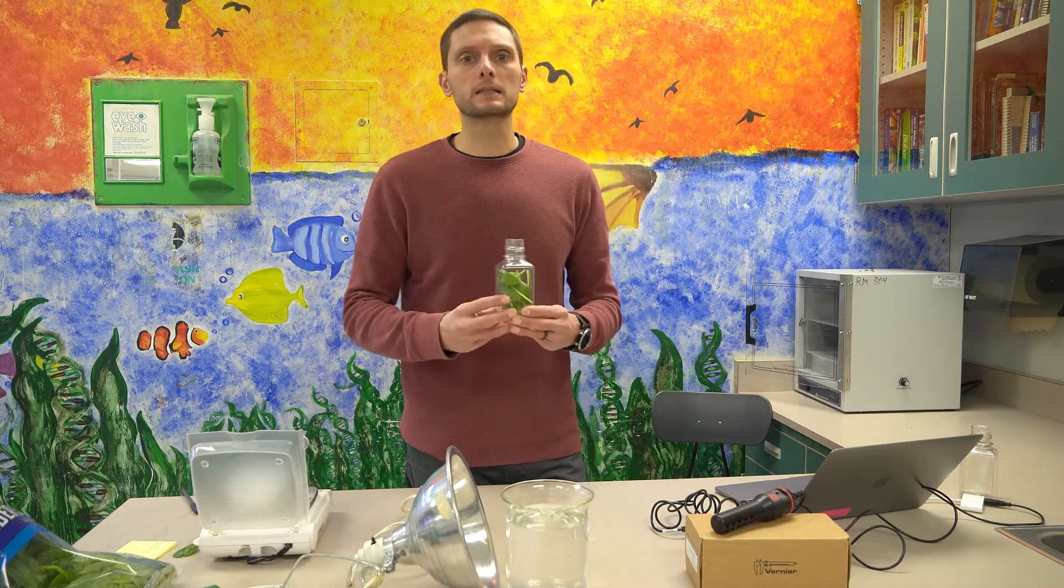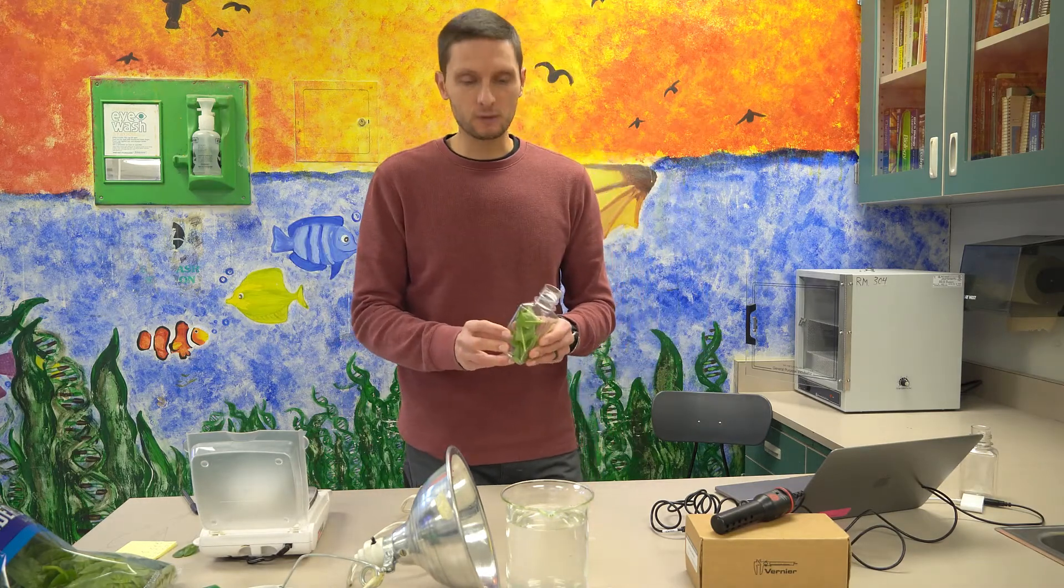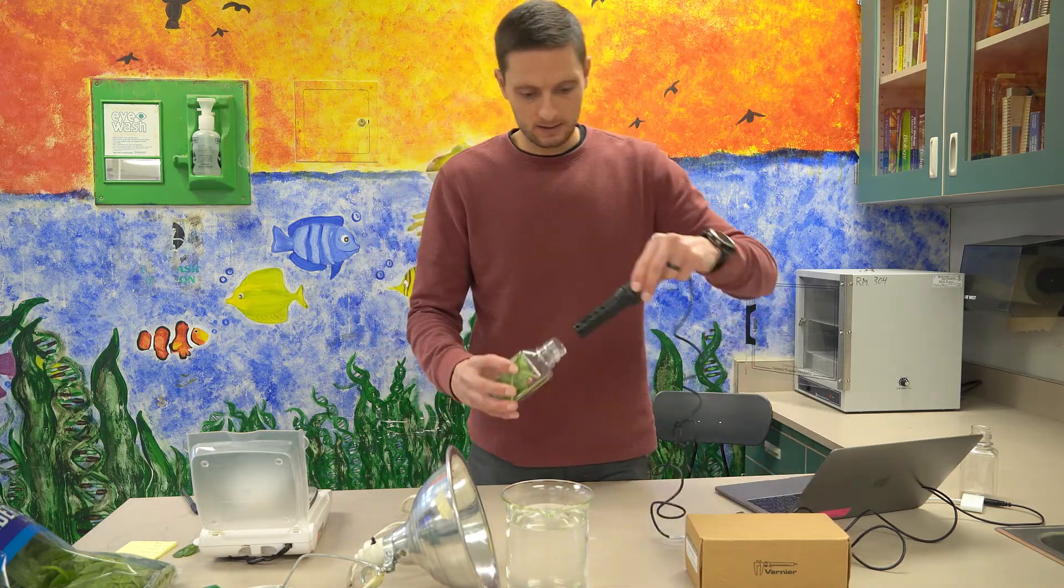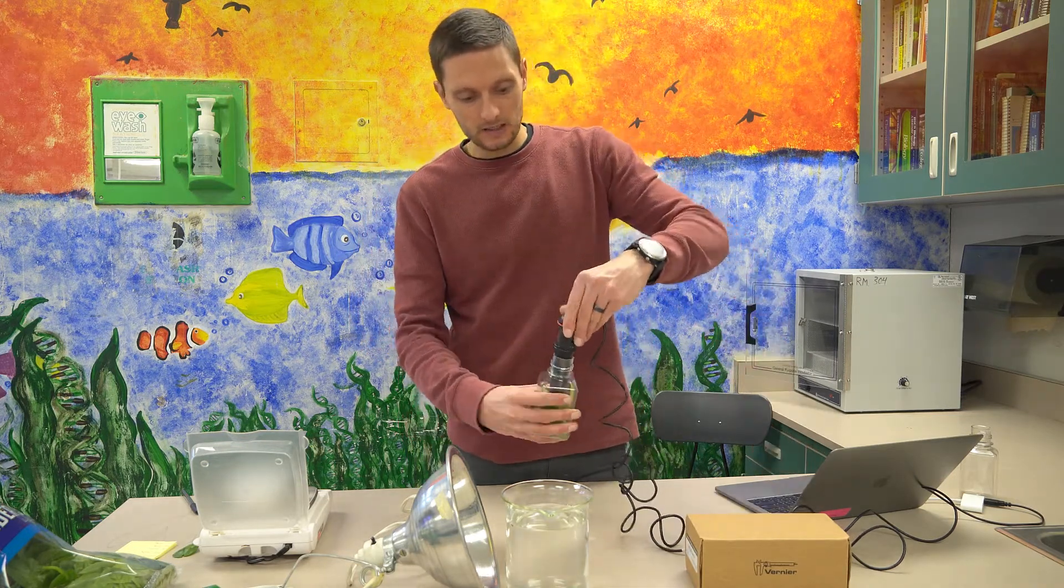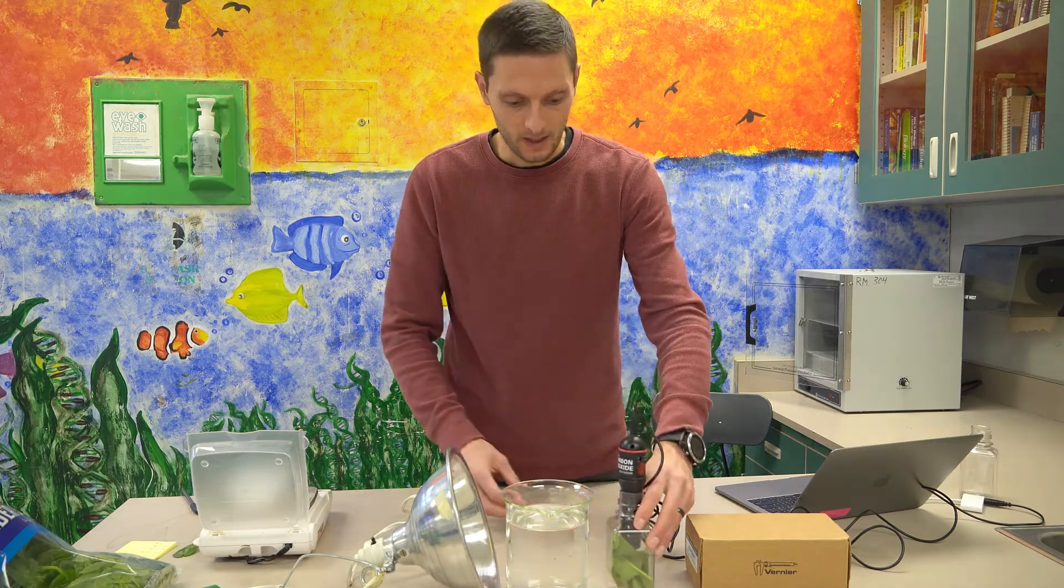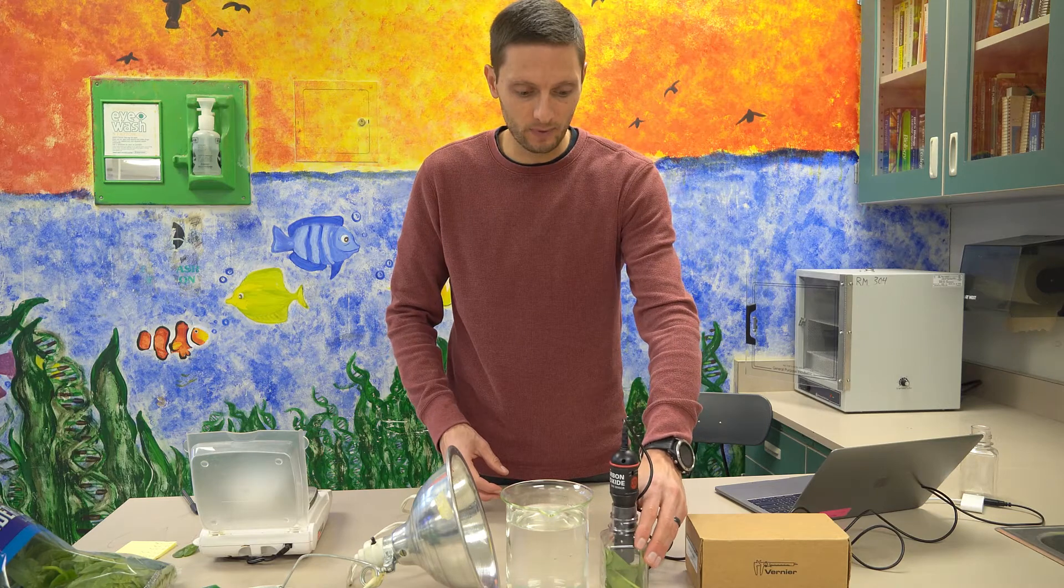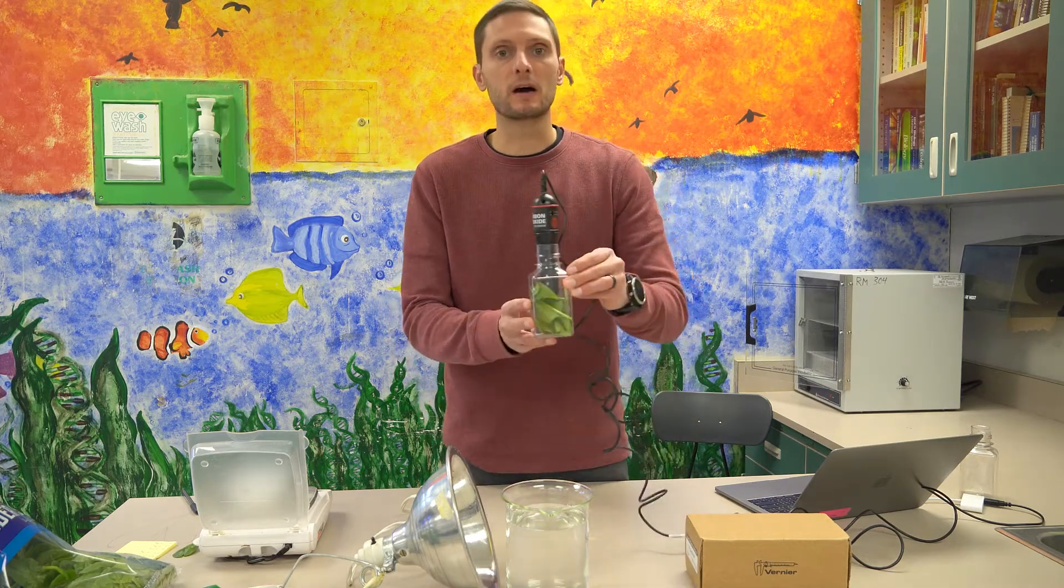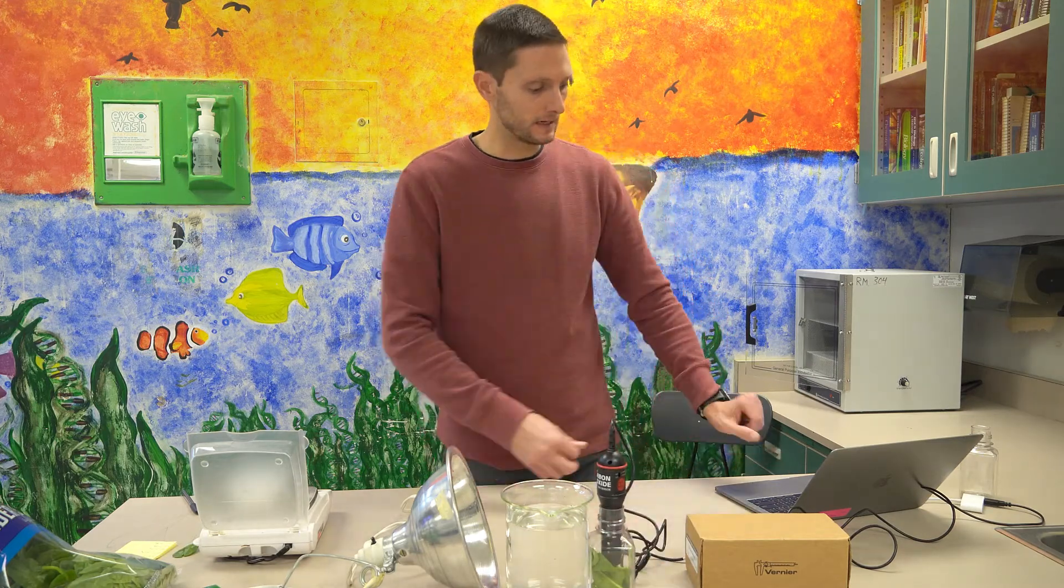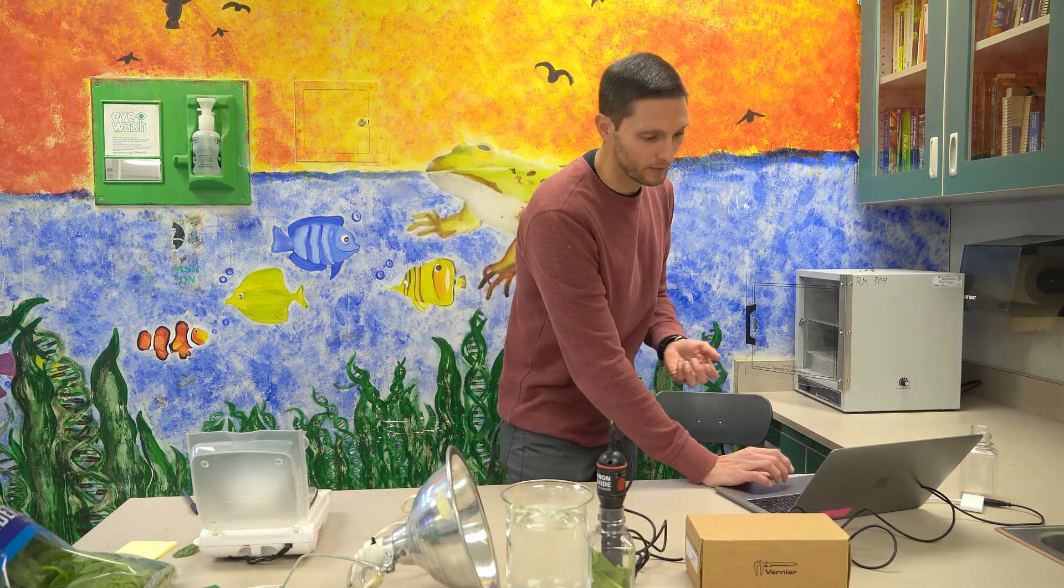Okay, so I've got spinach in our biochamber here. And next what I'll do is insert the carbon dioxide gas sensor into the biochamber here. And on my computer, I'm going to be using the Vernier program LoggerPro in order to be able to collect the data. So I've got that opened up already.